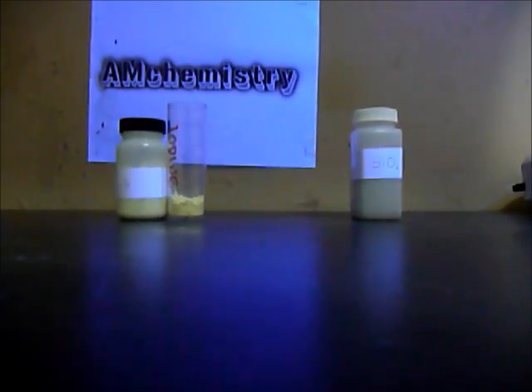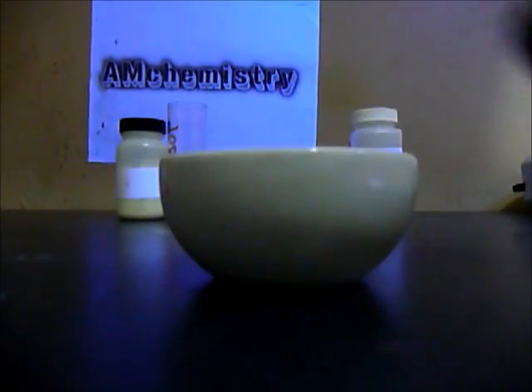To get the best results, heat your silicon dioxide and grind it into a fine powder. After grinding, you can clearly see that it's kind of like a powder.